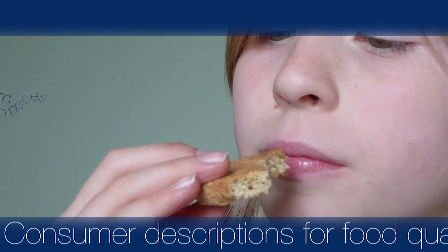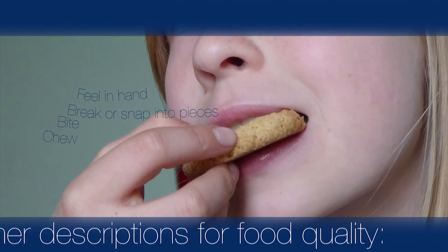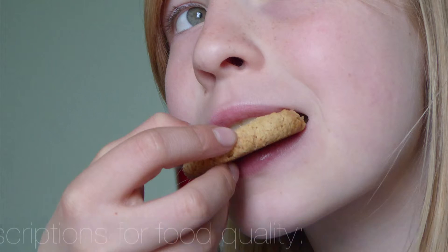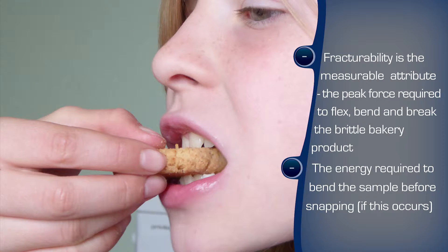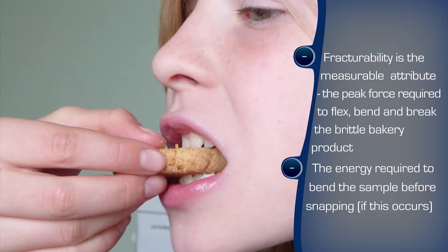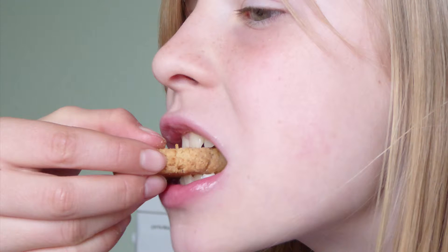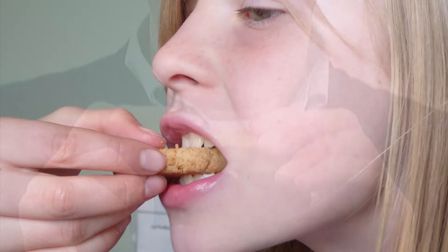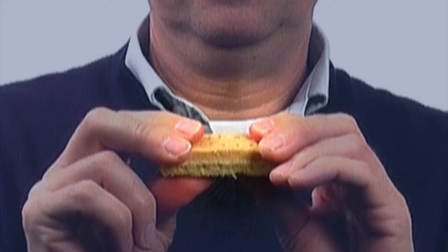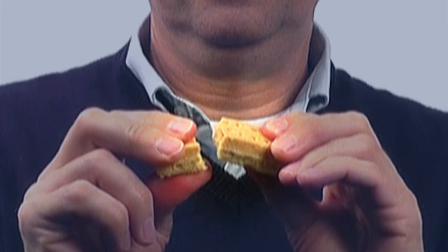A consumer may describe the sensory quality of food with different terms, for example crunchy, crisp, soft, firm, fresh or stale. Consumers judge the quality of food in a sensory manner, evaluating the texture primarily through touch, mouthfeel and in other ways that they interact with the product. For a hard crunchy bakery product, its snapping characteristic conveys freshness and provides the crunchiness.